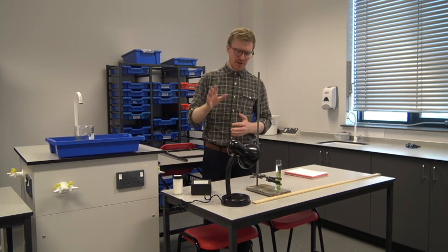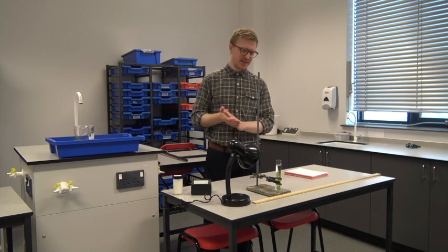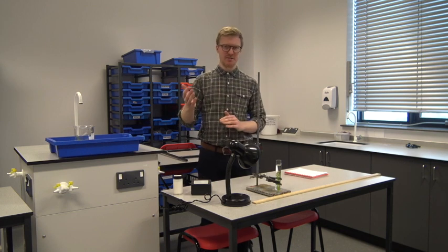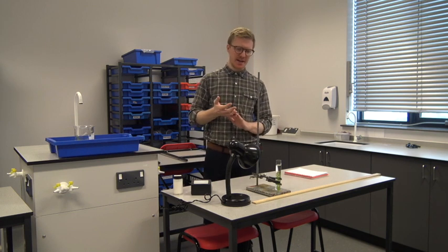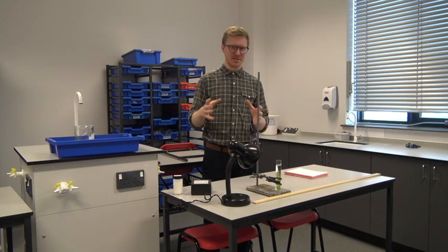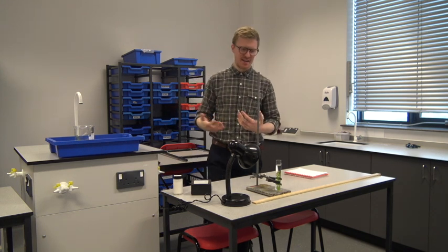So in this practical, we're going to be measuring light intensity as our limiting factor and our variable. What we need to remember is that, as with all experiments, we keep the rest of the experiment exactly the same.